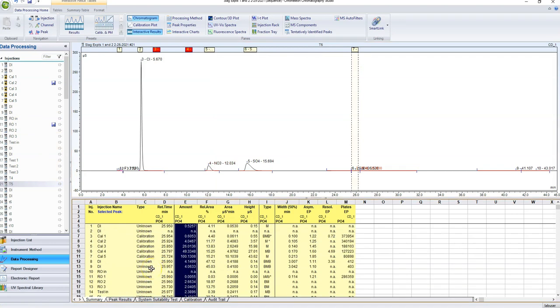So that's basically how you do everything in a really basic manner. But there are a ton of different ways that we can analyze our samples with this process. And like I said earlier, the easiest way is to practice and play around with it. So don't play around in somebody else's files, because you could mess up their processing method. Play around in your own, and ideally with your own processing method, something that you made yourself. But I'll talk about some of the most useful tools right now.